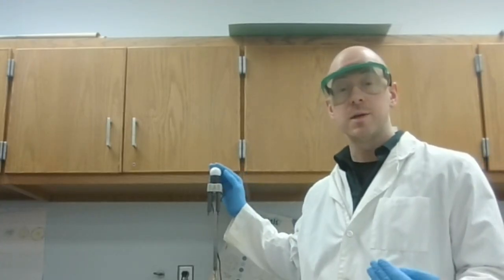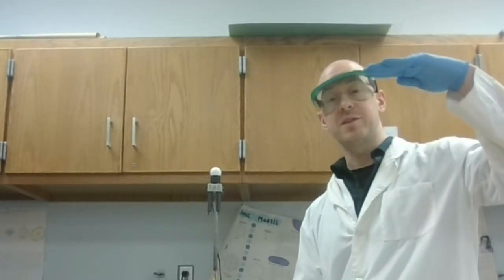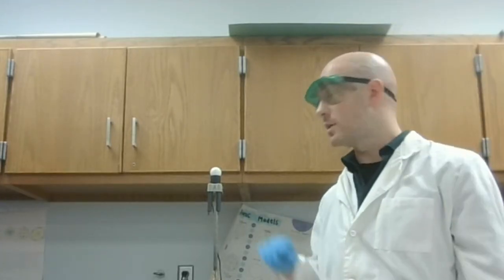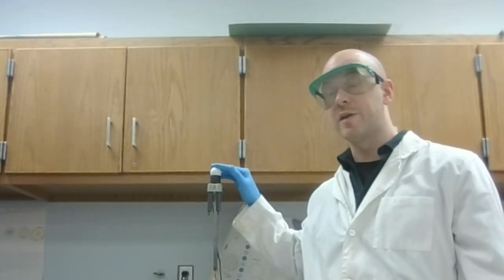Now for our last test, we're going to test conductivity. We're actually going to use our results from the solubility test to see, is it conductive? If it is, this light bulb will light up, and if it's not conductive, it won't. And actually, we'll have 3 levels of results here. We'll say no if the sample is not conductive, low if the sample has low conductivity, or high if the sample is highly conductive and makes this light bulb glow very bright.